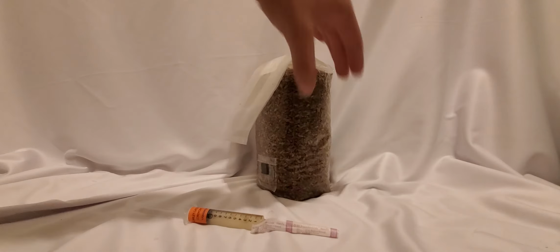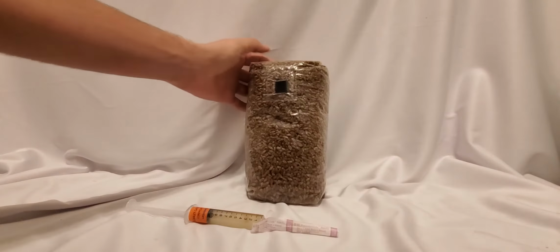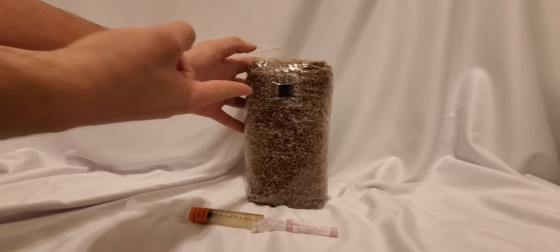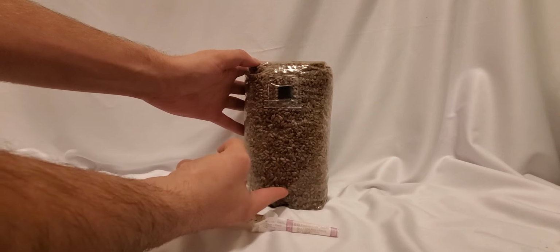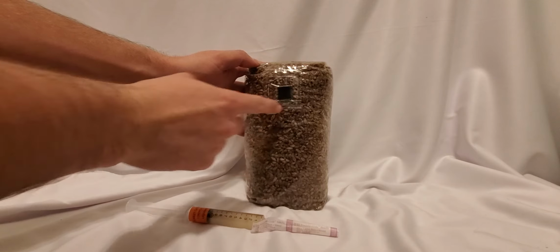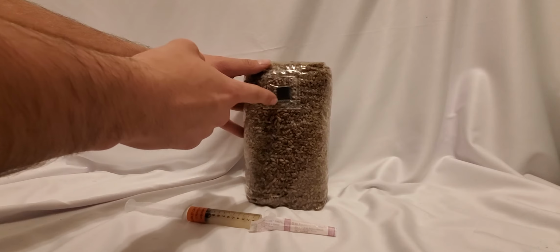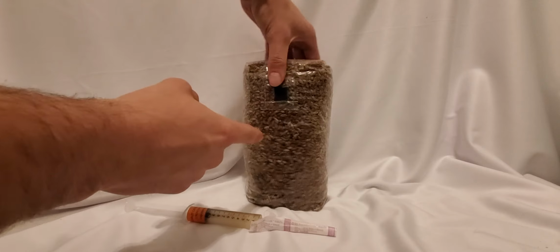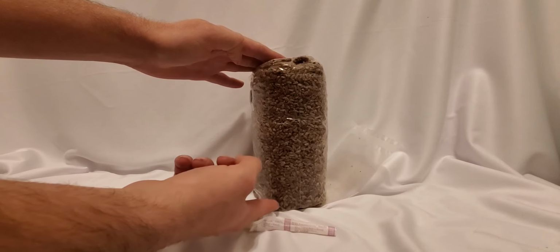A better way to do it is to turn the bags upside down so they're in this position, and then that way, when you inoculate the bags, the liquid goes all the way to the bottom, causing a strip of mycelium to form, and it only has to colonize the width of the bag instead of all the way from the top to the bottom.